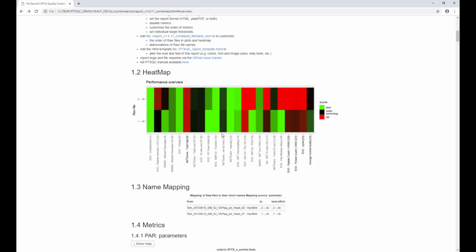But looking at this heat map, we can already see those two files, which were supposedly repeated measurements of the same sample, didn't quite yield the same results. The file here definitely has some problem, and now we need to figure out what it is. So as I mentioned earlier, some of the metrics are dependent. So we can, for example, see that the peptide intensity of all the identified peptides is worse in the second sample than it is in the first. Also, you see that the top N MS2 spectra that the instrument decided to do is not very nice. So there's probably potential for optimization here, but that might not be our primary problem.